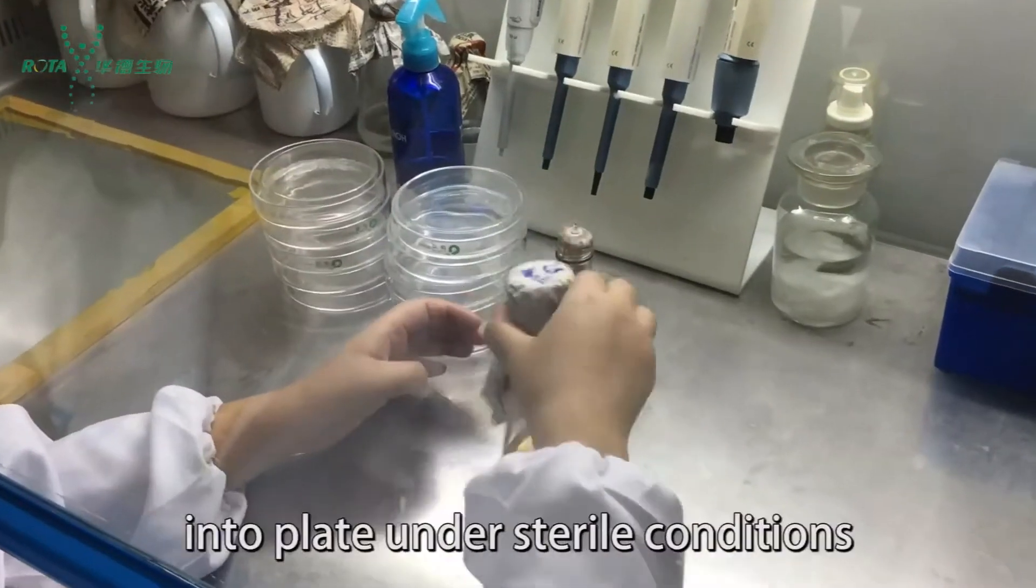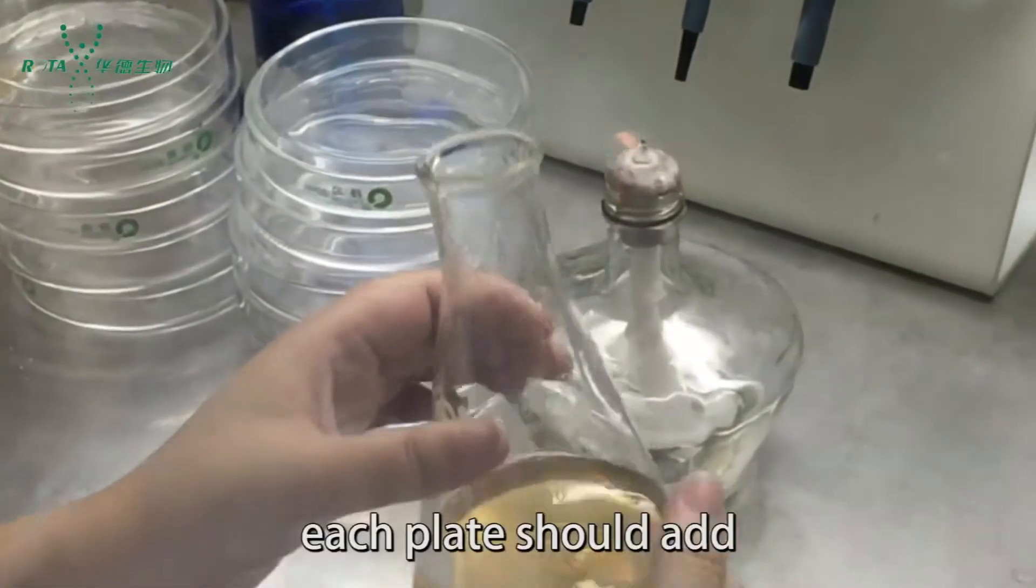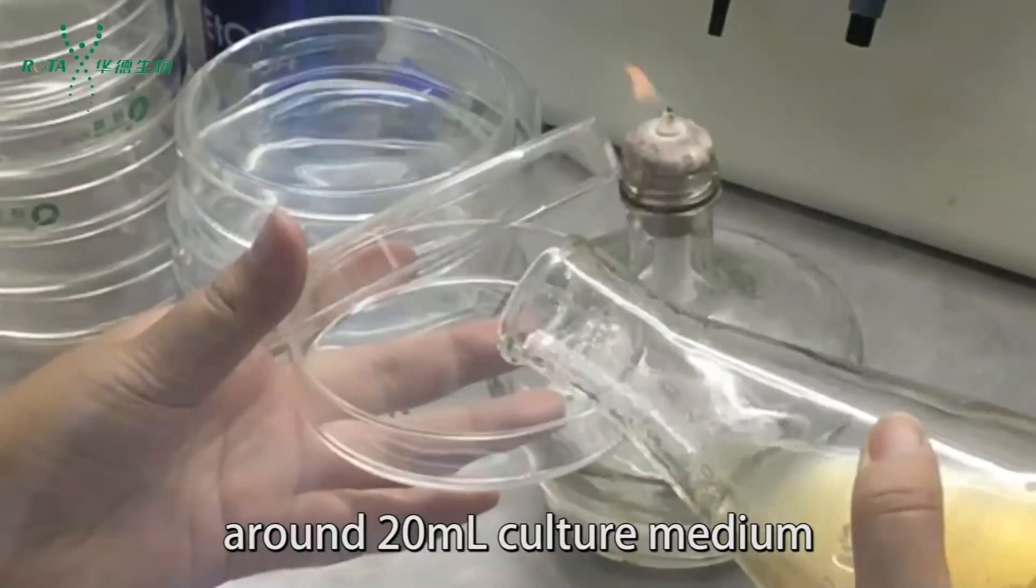Pour culture medium into plates under sterile conditions. Each plate should contain around 20 ml of culture medium.